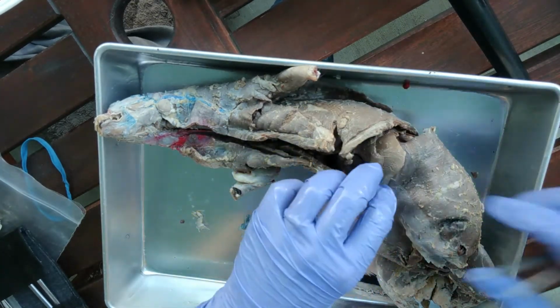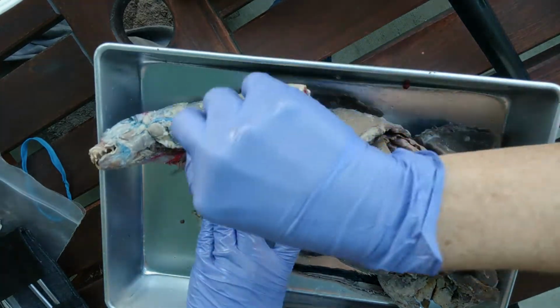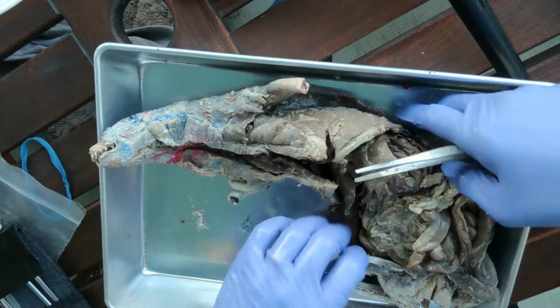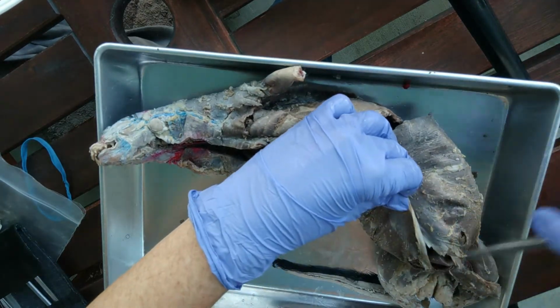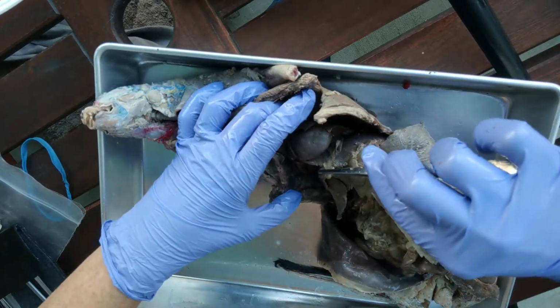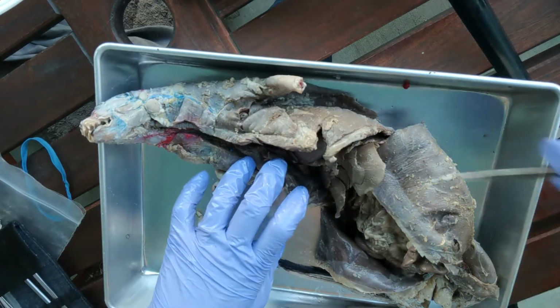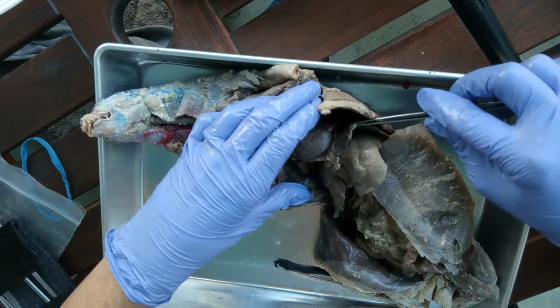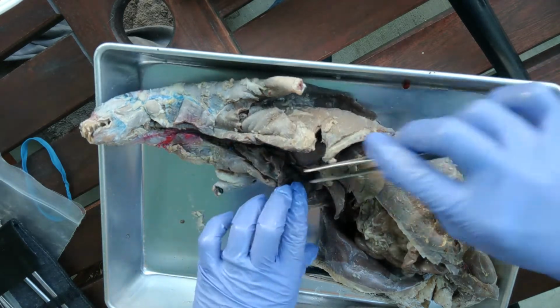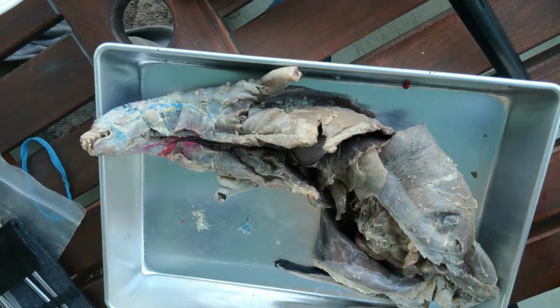The ventral cavity has two subdivisions. The first is the thoracic cavity. Thoracic means chest. And then we have the abdominal pelvic cavity, which is everything below the diaphragm. The diaphragm is the boundary between the thoracic cavity and the abdominal pelvic cavity, and that's this sheet of skeletal muscle right here. This is for breathing. It changes the shape and size of the thoracic cavity, and that's how you breathe.